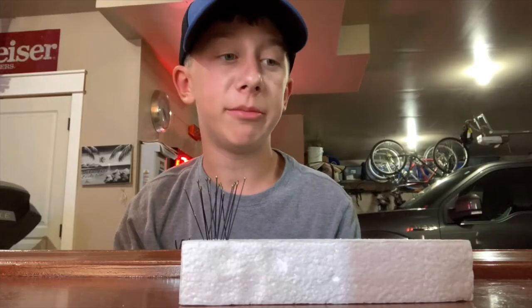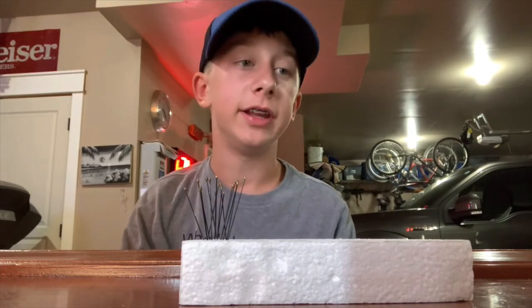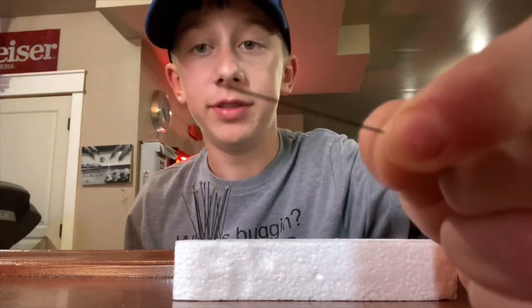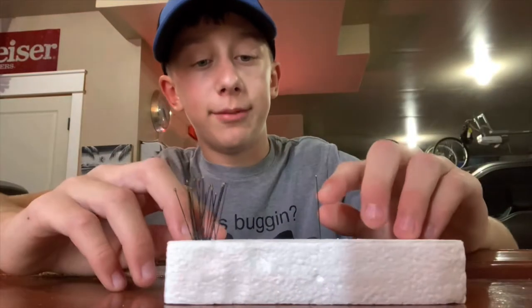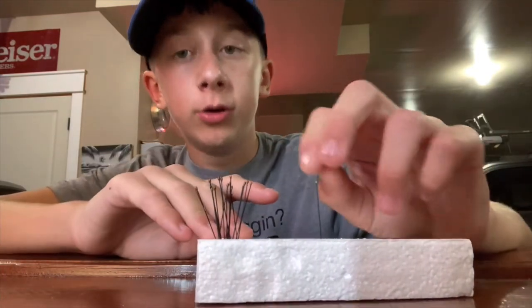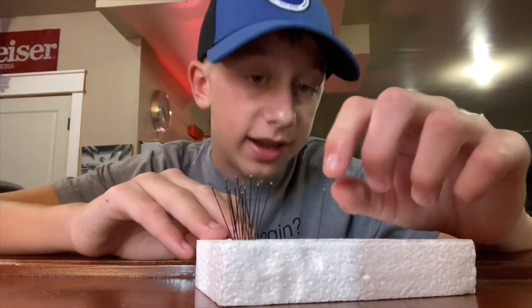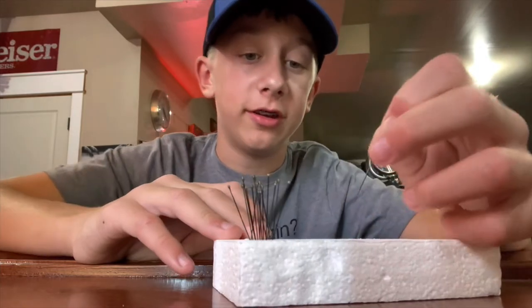In this video, I'm going to be showing you how to preserve arachnids. When you preserve insects, you can either put them in a vial filled with alcohol, or you could pin them with insect pins. Underneath them you put two little labels saying who caught them, where they were caught, when they were caught, what they are, what family they're in, what their scientific name is, what their common name is, what order they're in — all sorts of entomology stuff.